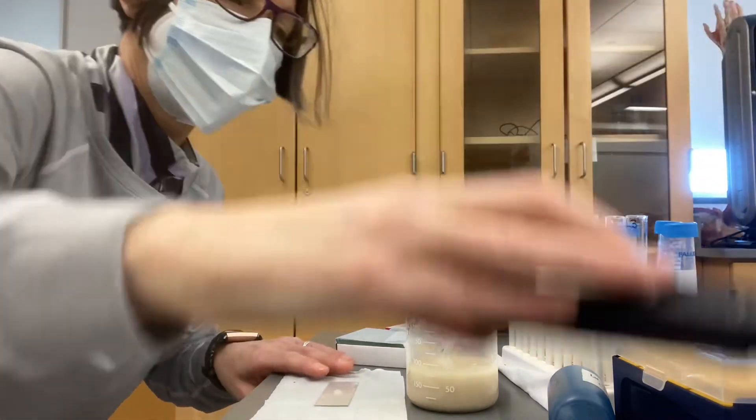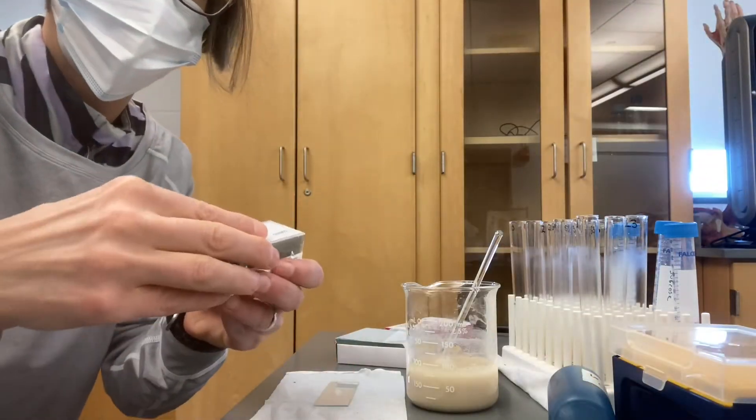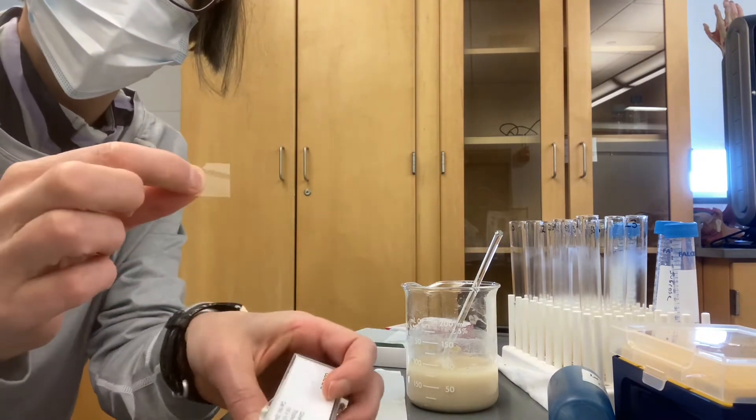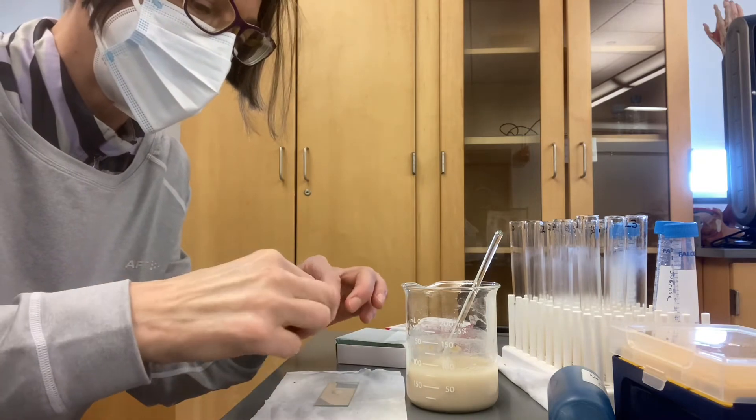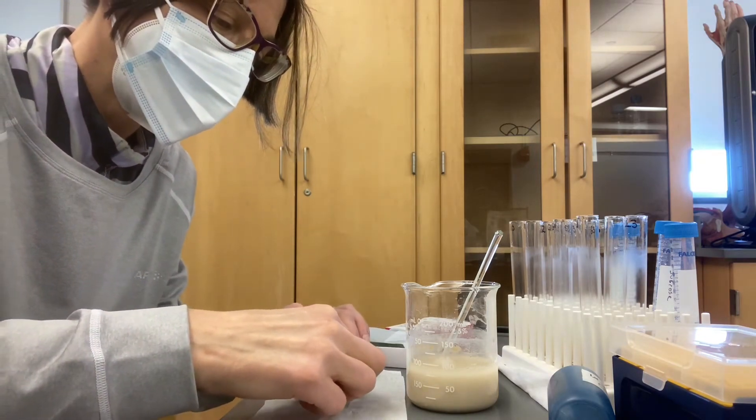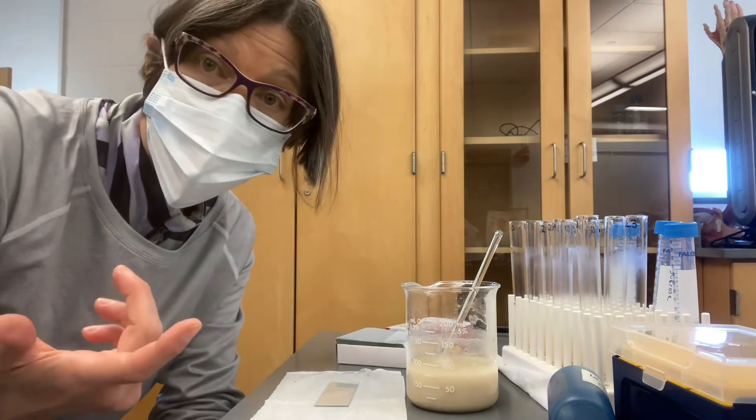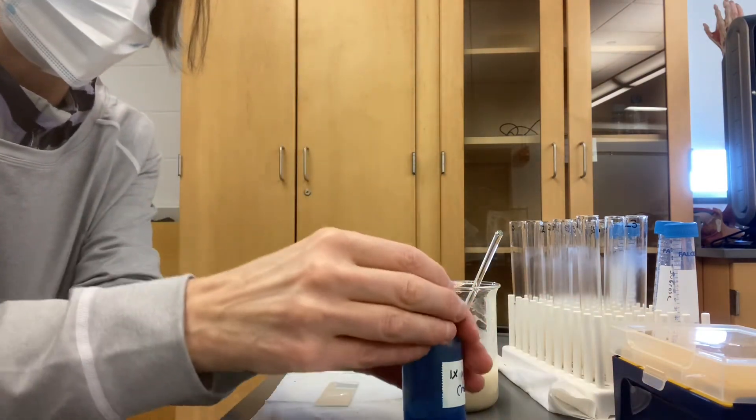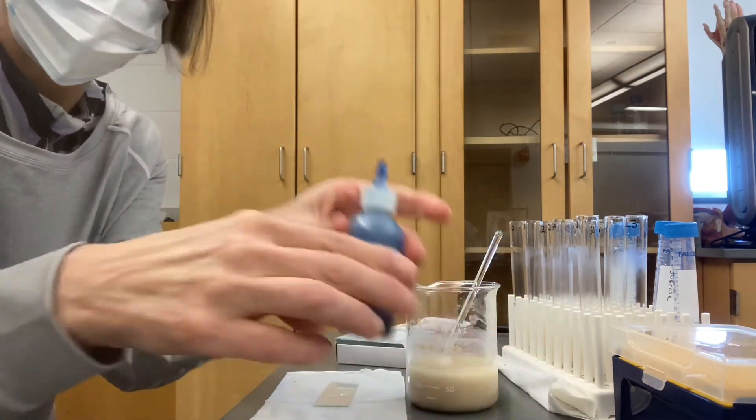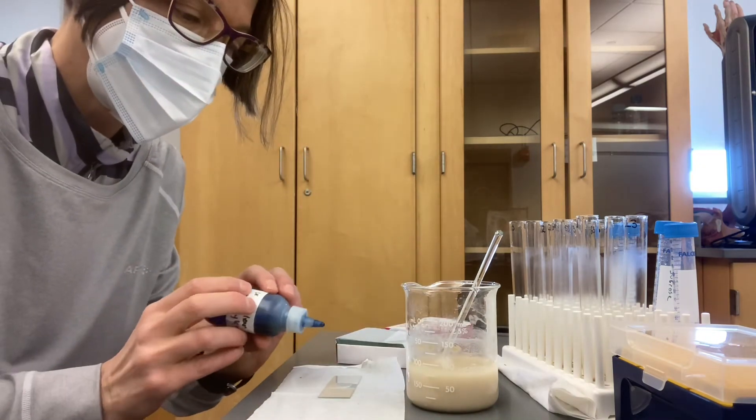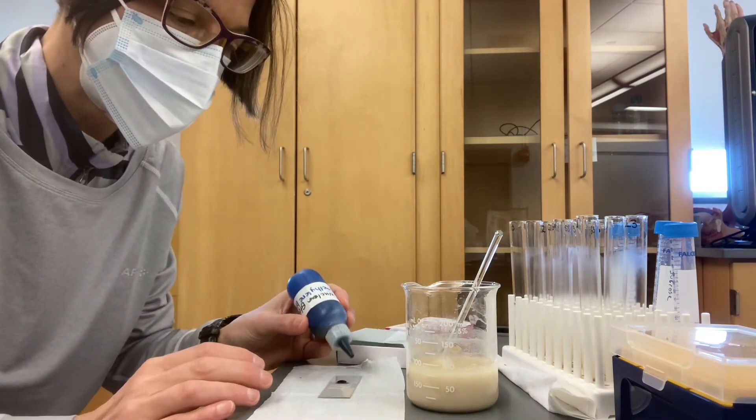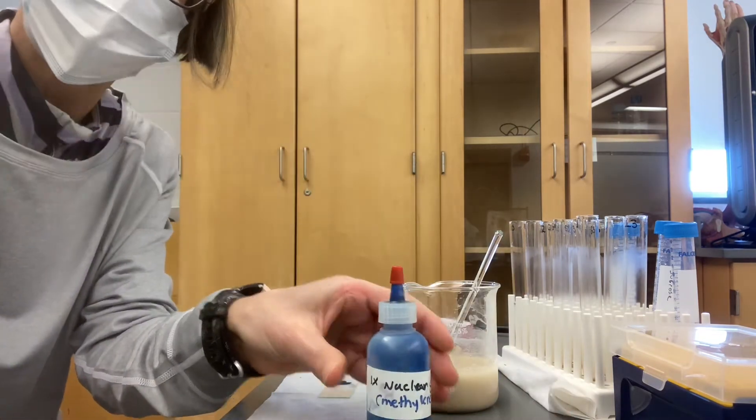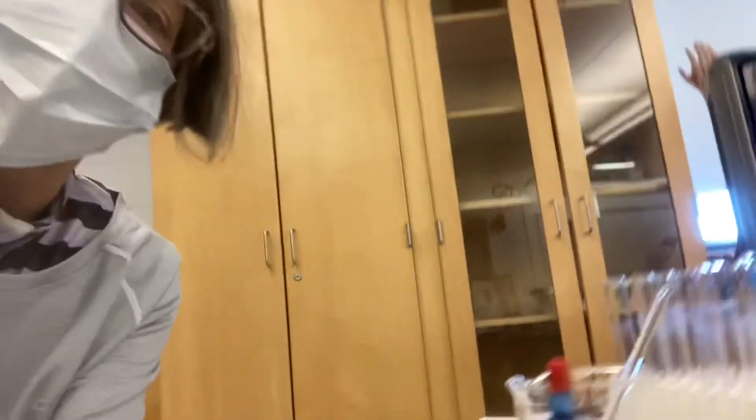Ditch my tip. Then I will put a cover slip onto the top of the yeast. Now I've got a wet mount. Then I will take my methylene blue and I will pop the cap off it. And I will take the methylene blue and I'll make a drop right beside the cover slip.